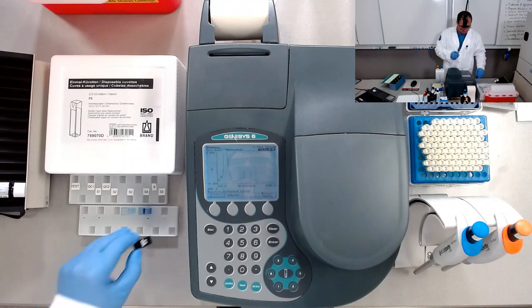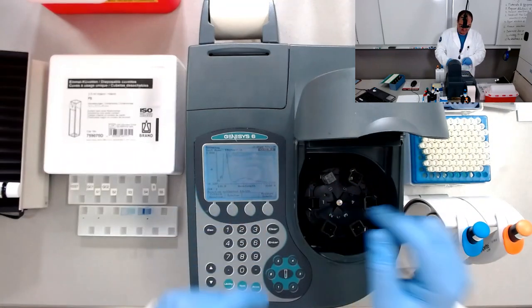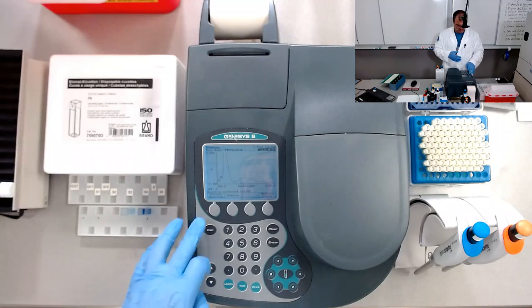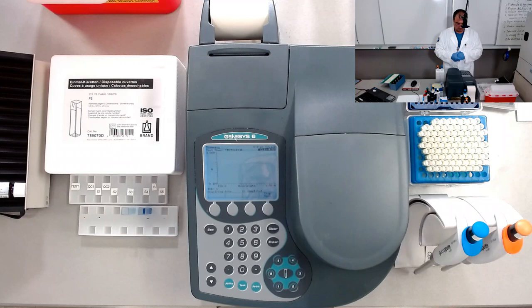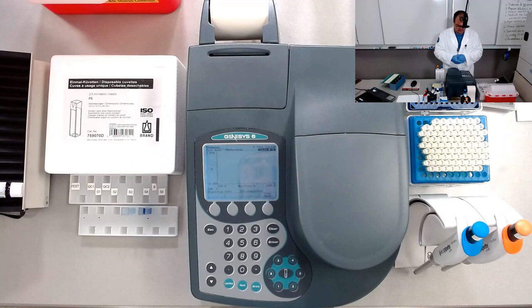Now let's measure the sample. So be careful. We're going to place the sample in position 1 as mentioned in there, cell 1. The direction of the light beam is this way. So now let's measure the sample. It starts from 1100, plotting the graph. You look at that one.